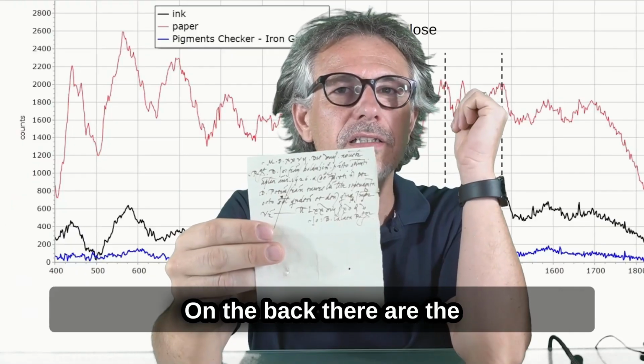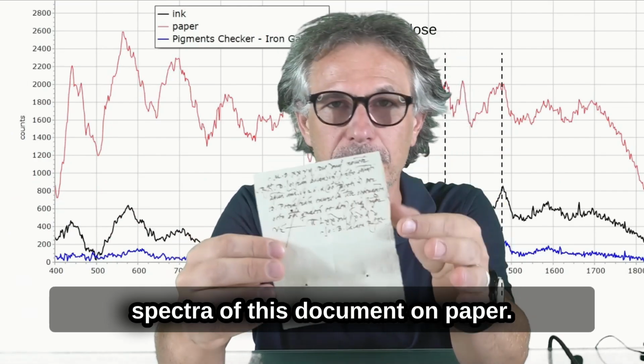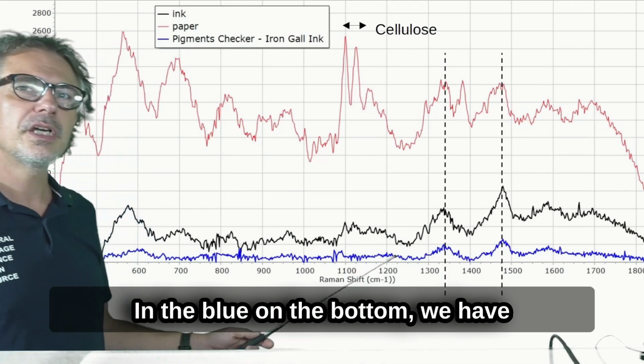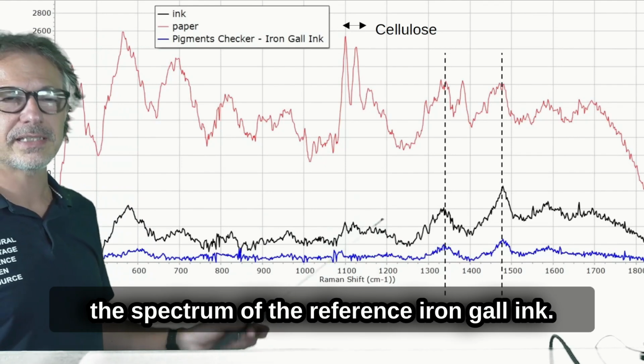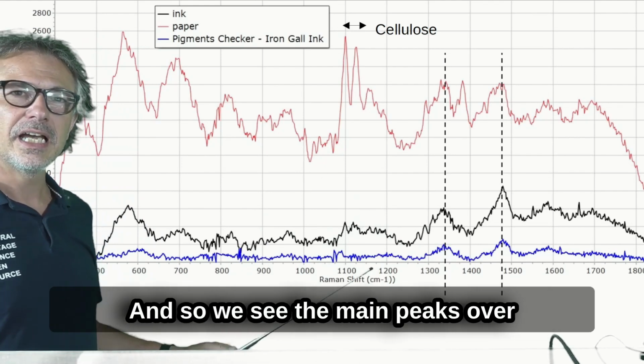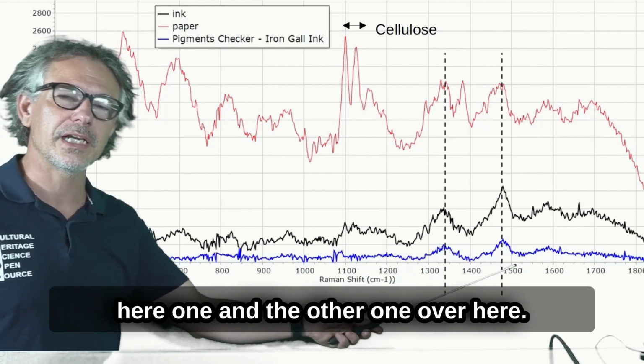On the back, there are the spectra of the document on paper. In blue, on the bottom, we have the spectrum of the reference iron gall ink, and we see the main peaks over here, one and the other one over here.